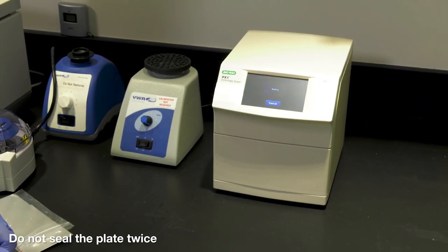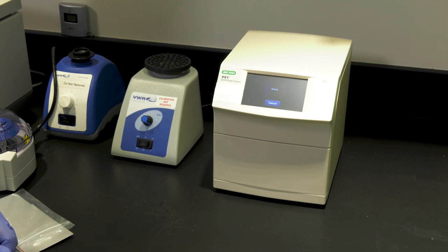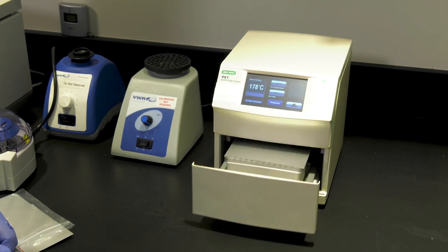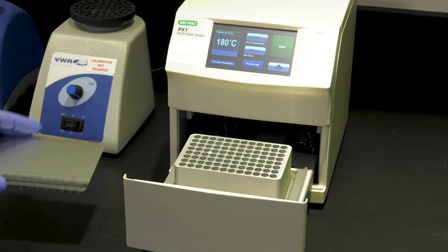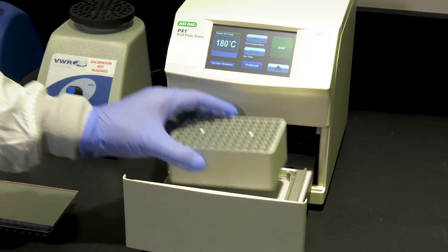Only seal the plate once. Do not double seal it. Remove the sealed plate and block from the sealer and close the PX1.